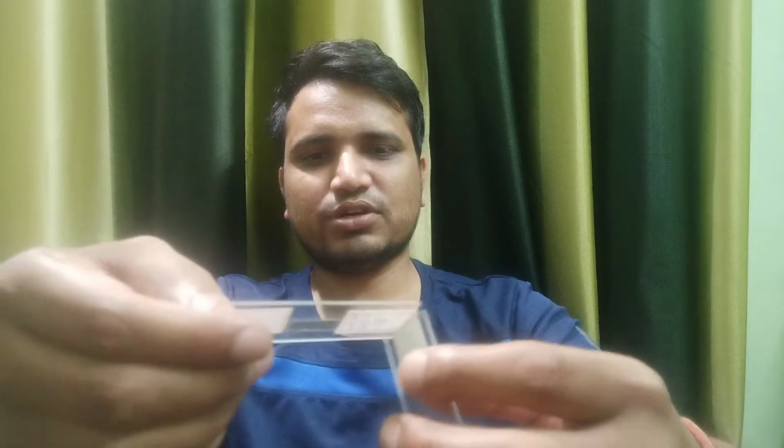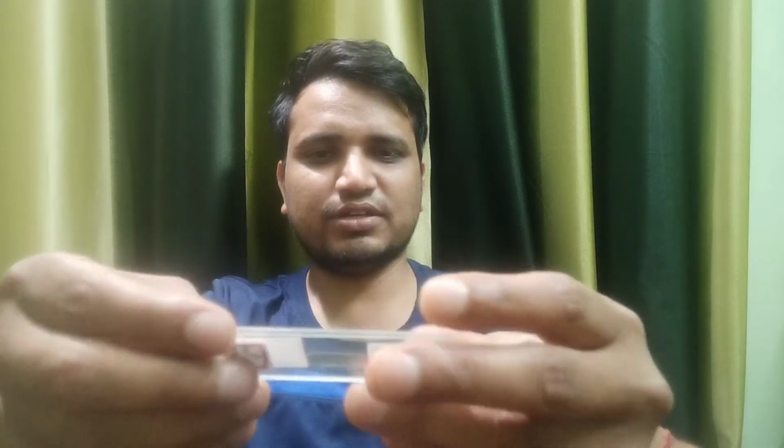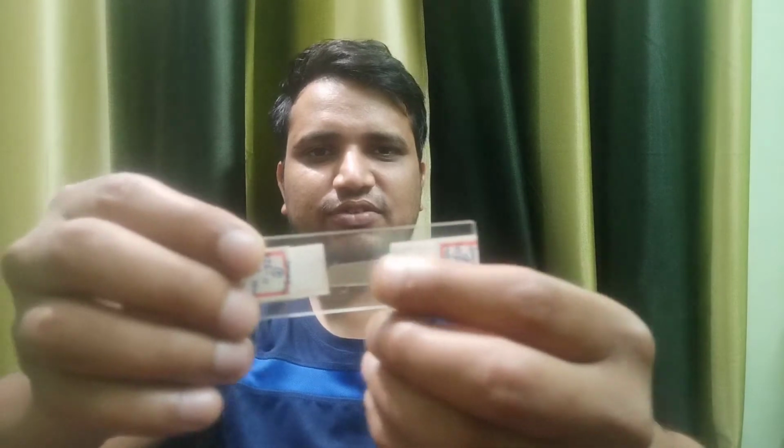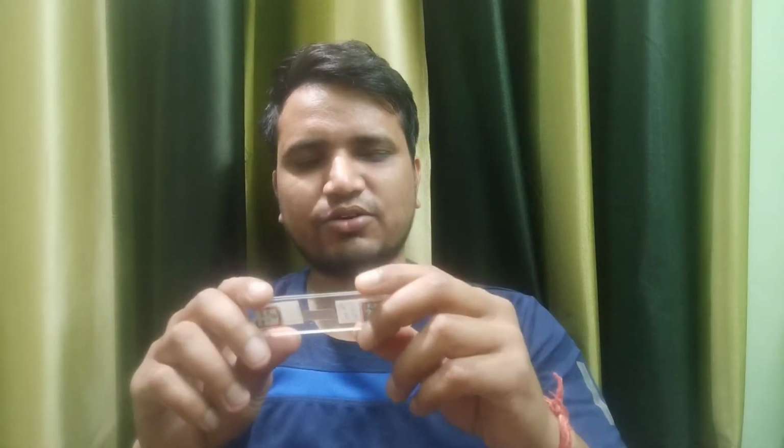After this, to conserve it and not allow it to be destroyed, we make contact with another glass. So we put another glass over there, and this is the thing which we see in the microstructure. Okay, so when we see it under a microscope, we get the image of that. This microstructure is not very perfect compared to what we see once we do the polishing of the sample in the mold and everything. But it serves the purpose.